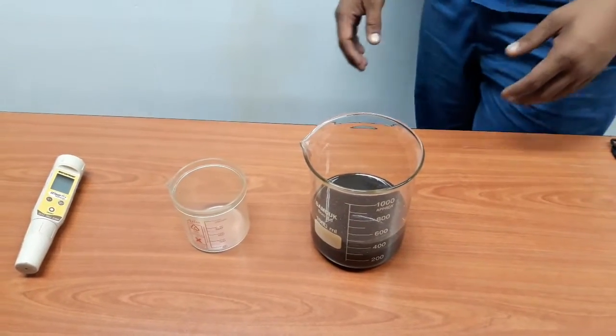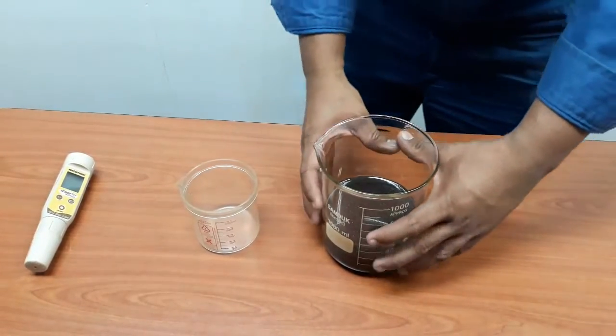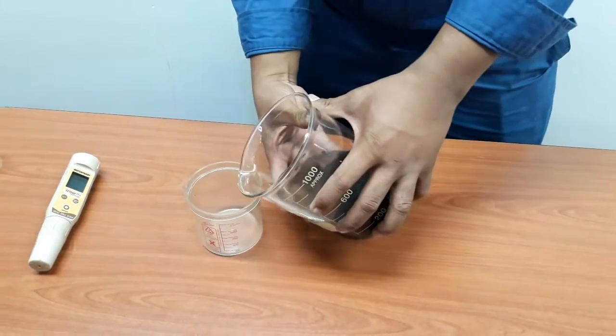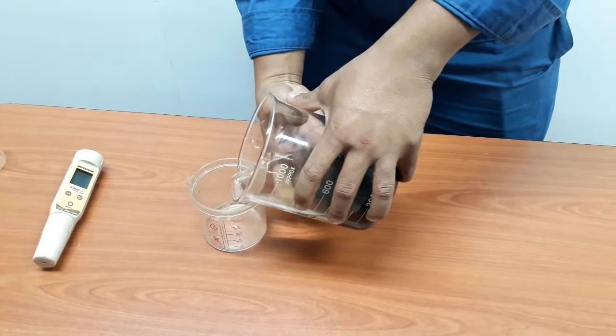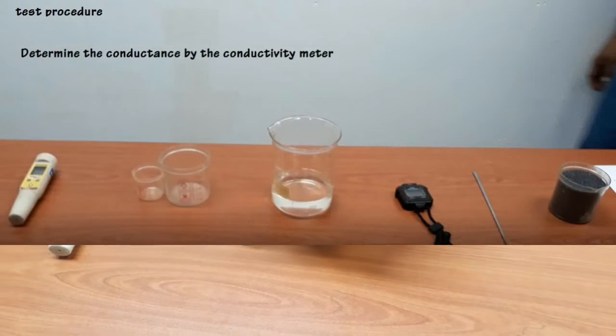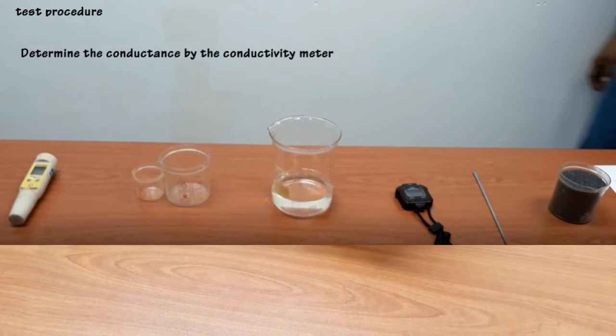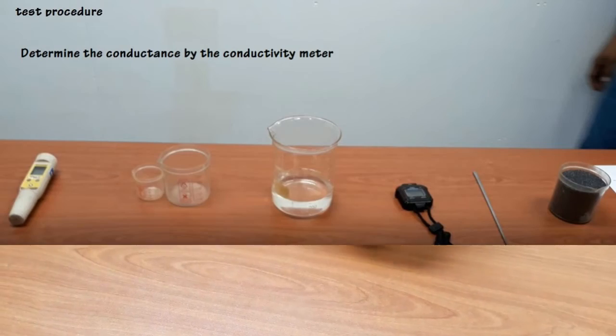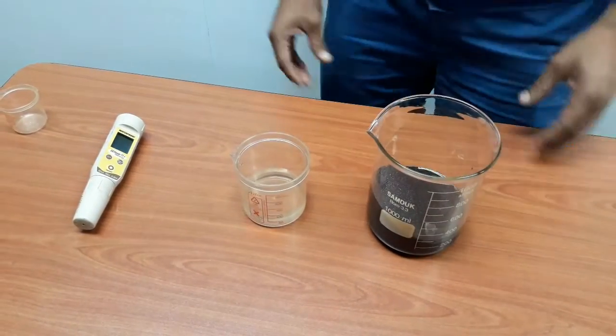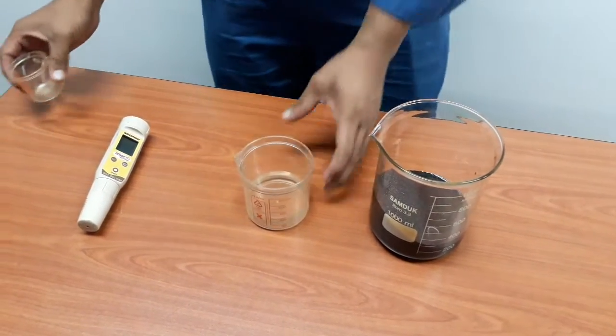Filter sufficient slurry liquid for test.